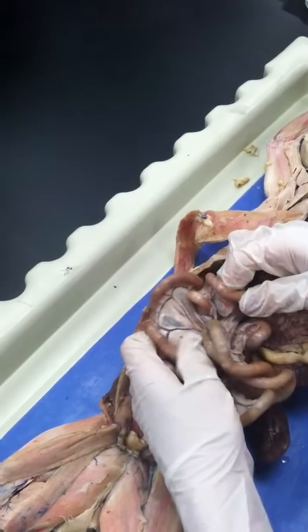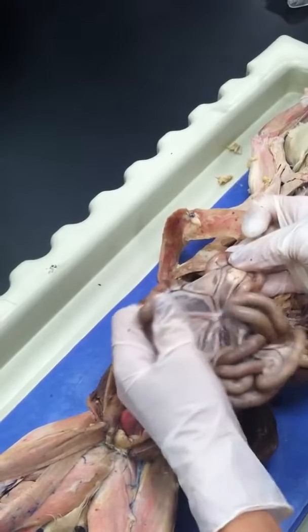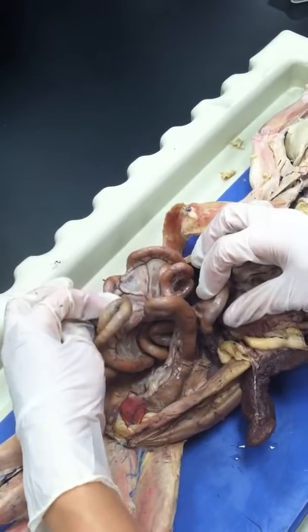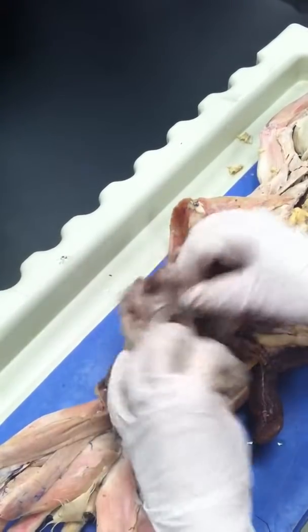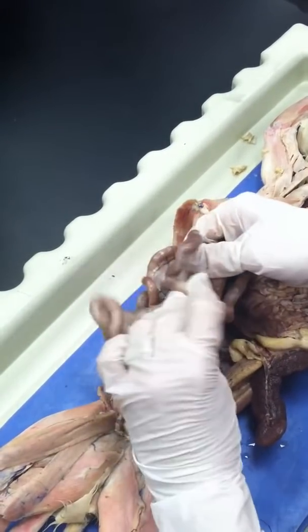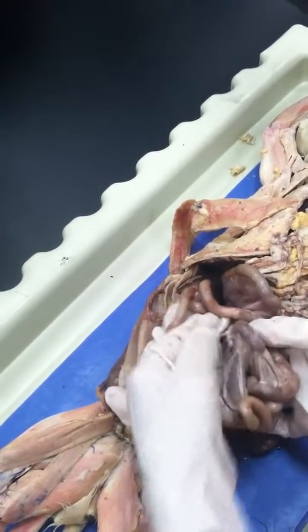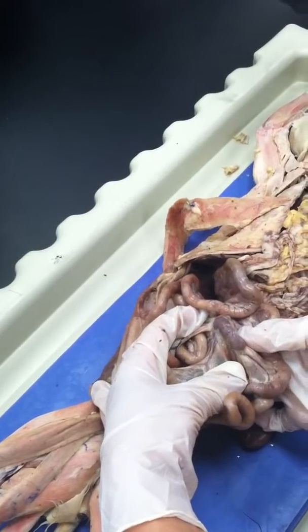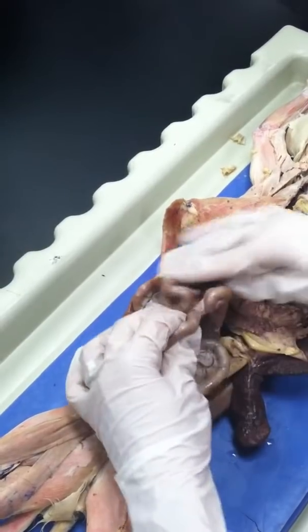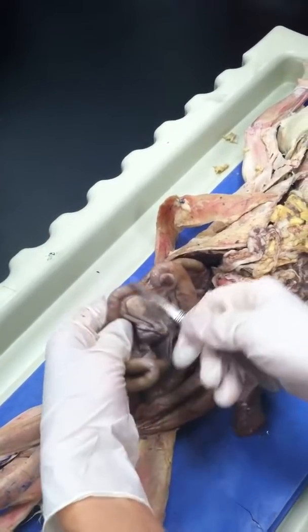In between the lobes, you have what's called mesentery, where the blood vessels go. Okay? And the last piece of the small intestine is the ileum. What is the ileum? It's the last part of the small intestine. And we said that the appendix was here. Yeah, that's the appendix. It's a large one. Should be inflamed, should do surgery to remove it. And then the end should be the ileum, and then starts the cecum.